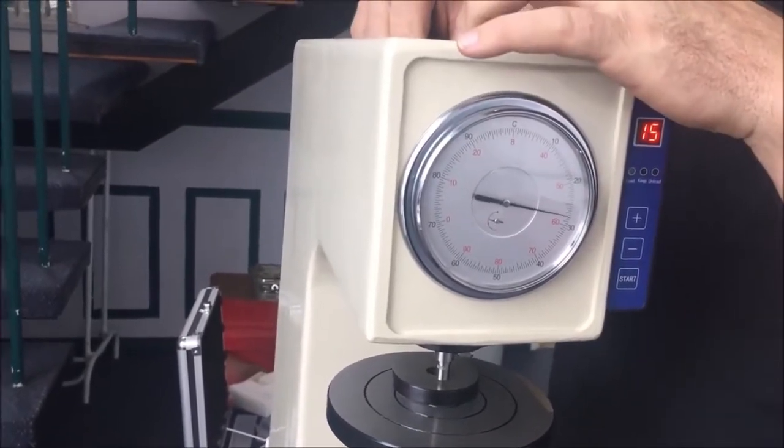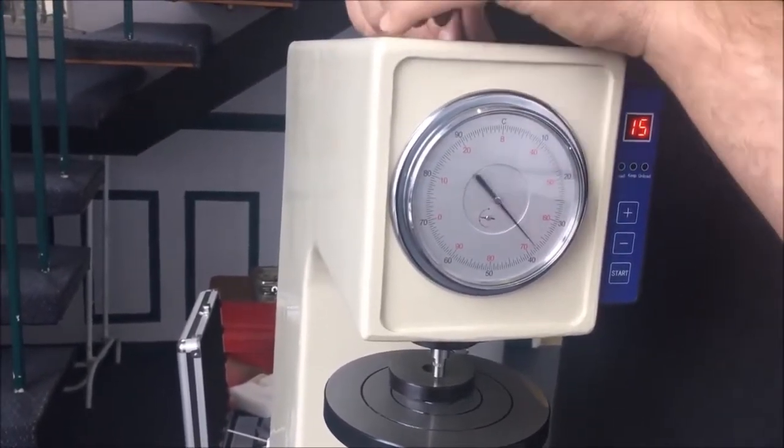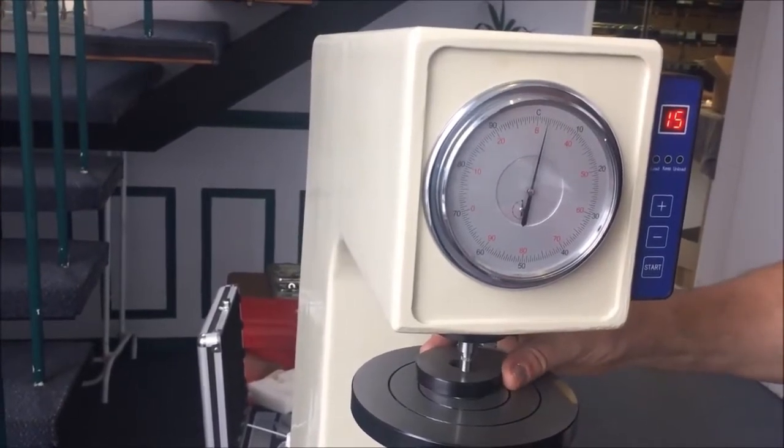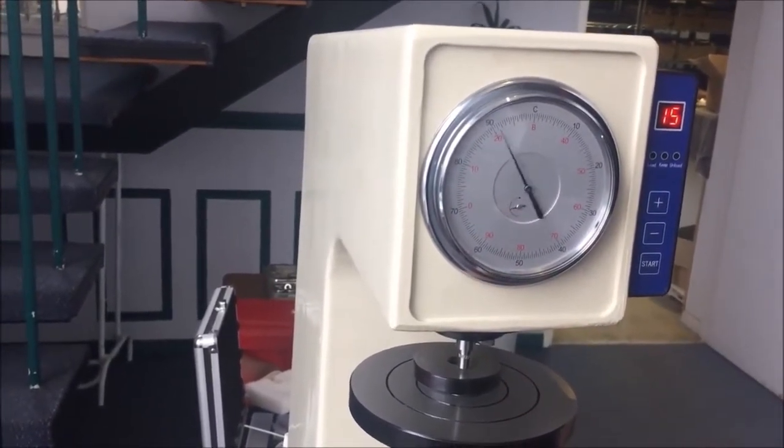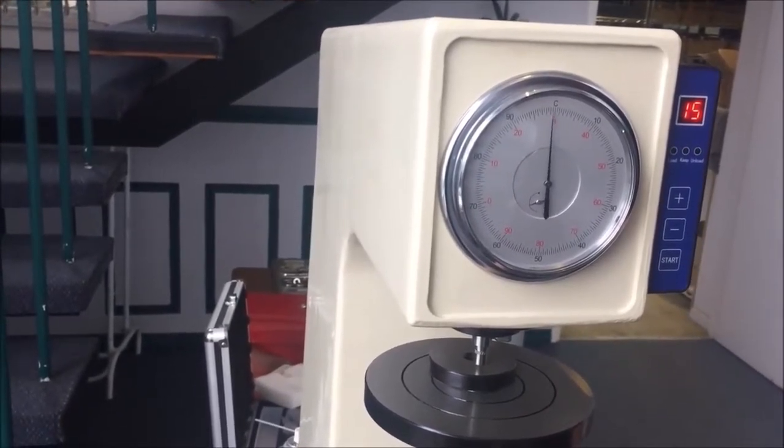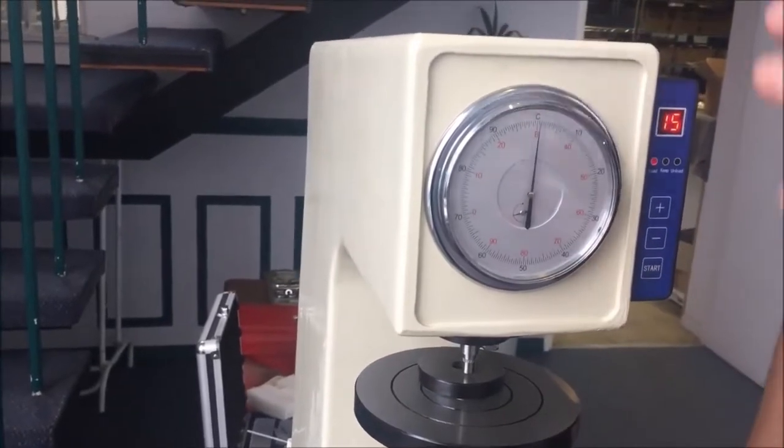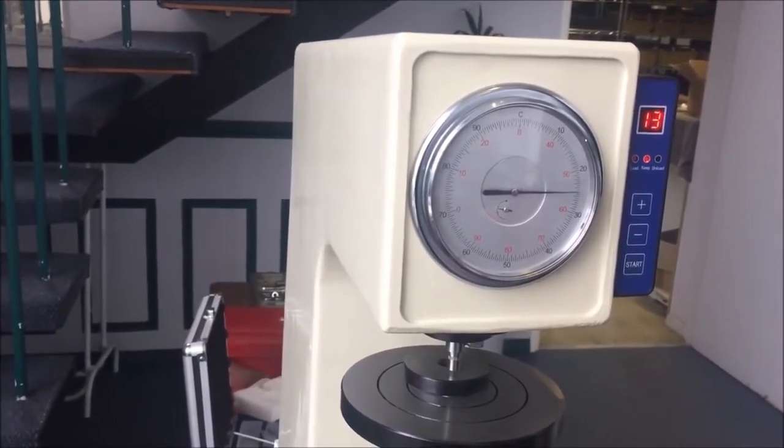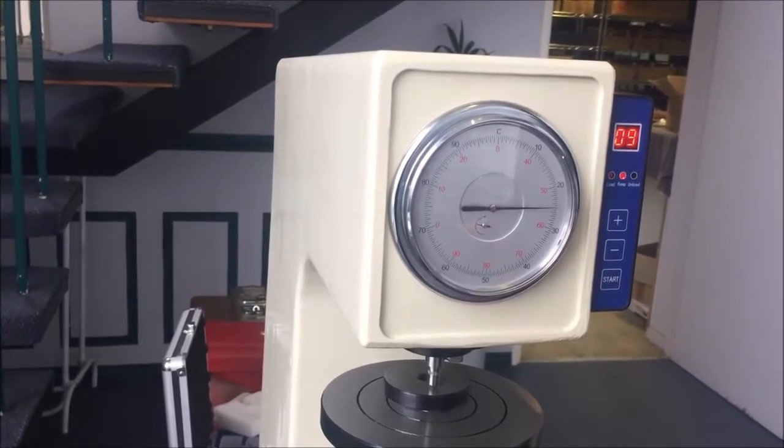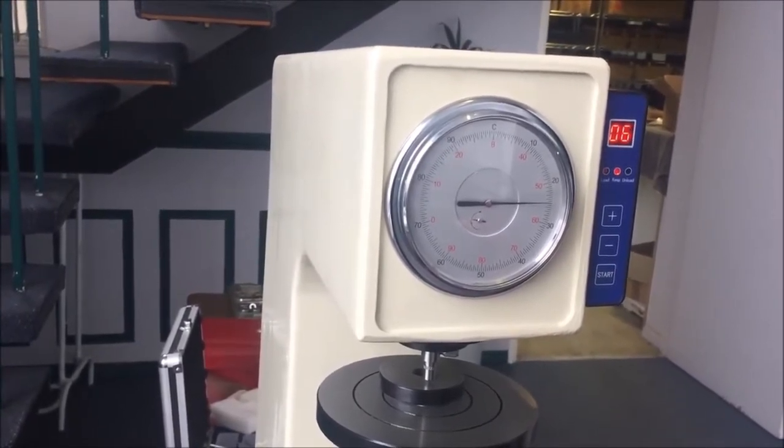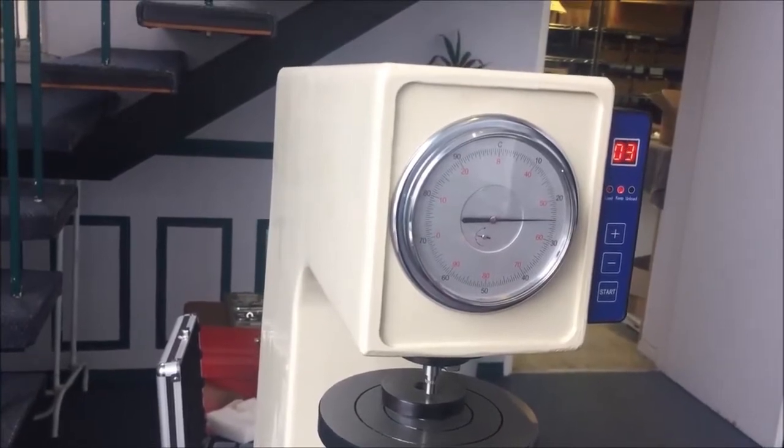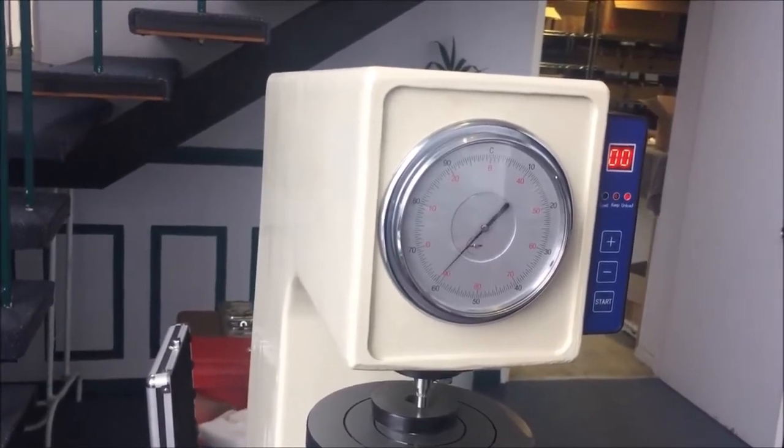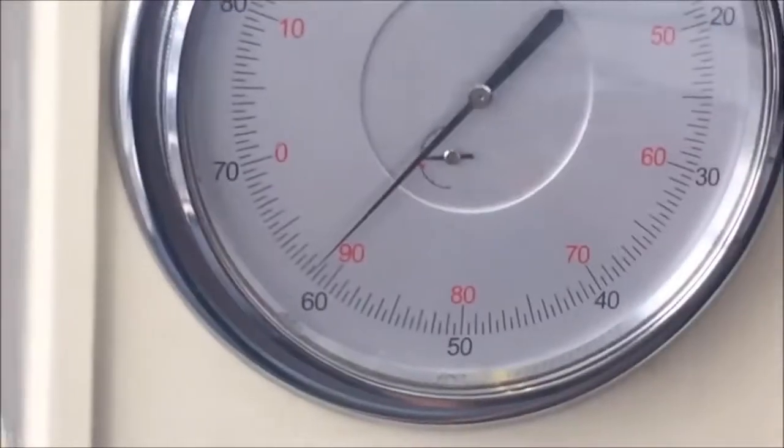61. Getting a little bit closer. I went back too far, so it's only the tiniest of turns pushing it back towards the dial just a little bit. Probably should take the weight off before you do that. Someone's going to tell me that. You probably want to care a bit more with yours than I do about this one. So just take the weight off before you make the adjustment. With a bit of luck we'll be bang on this time around. 61.5 on the nose. Thank you very much, have a nice day.